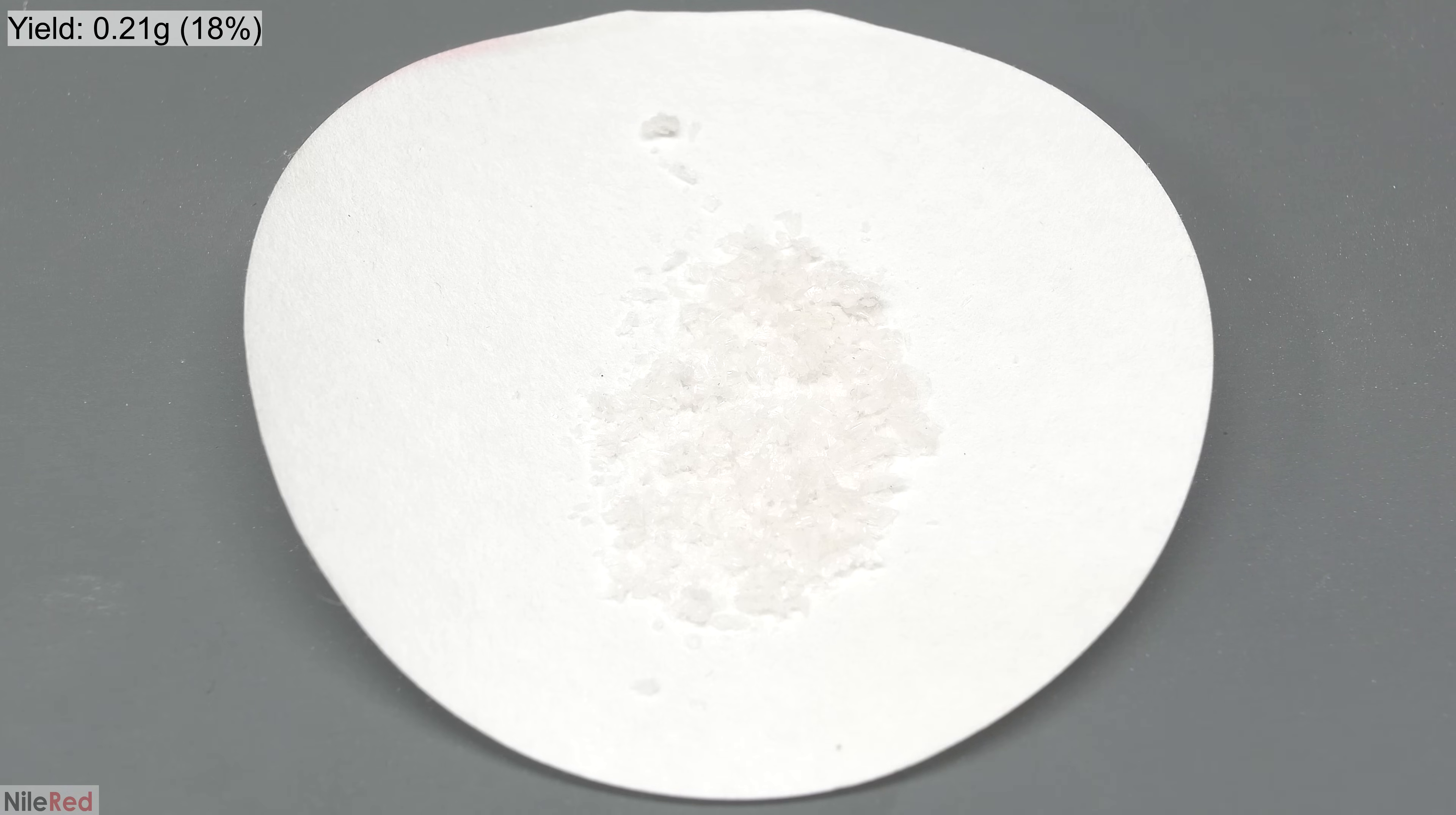In the end, the yield was 0.21 grams, which represents a percent yield of 18%. The major reason for the low yield is because I did multiple recrystallizations. Each recrystallization gave a more pure product, but I lost quite a bit in each one. It's very normal to lose some product when you recrystallize, but I think I lost a little bit more than I should have because I used way too much water.